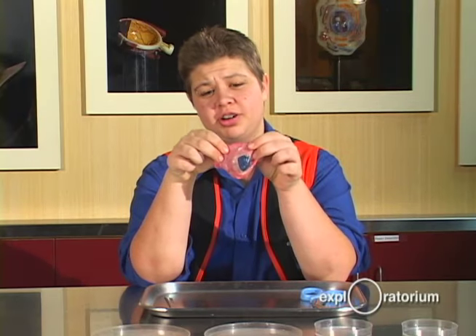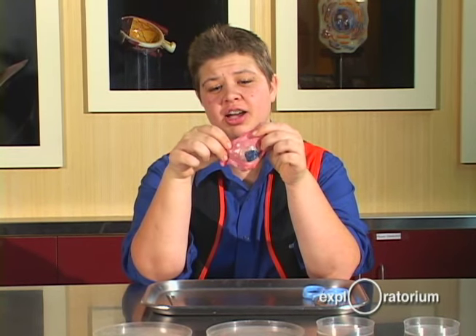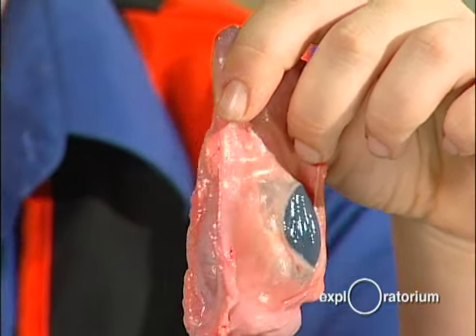This pink and white part is the fat and muscle. What the fat does is cushion the eye, because the fat and muscle wrap around the bone right here, holding the eye in place. So now I'm going to go ahead and cut it off.